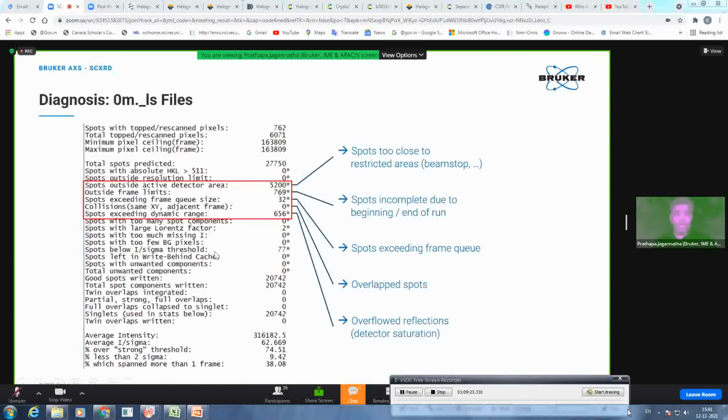And then after the integration, you always get the 0m._ls file. That's the output file of your integration. You can look at those files carefully, and on the top itself it is written. I have highlighted it in this red box. You can see the spots outside active detector area. This can be due to spots missed because of the beam stop or your cryo stream or something else. There are some spots which might be outside your frame limits, or spots incomplete due to the beginning or end of the run.